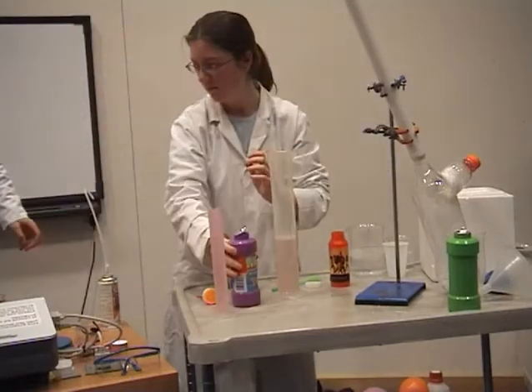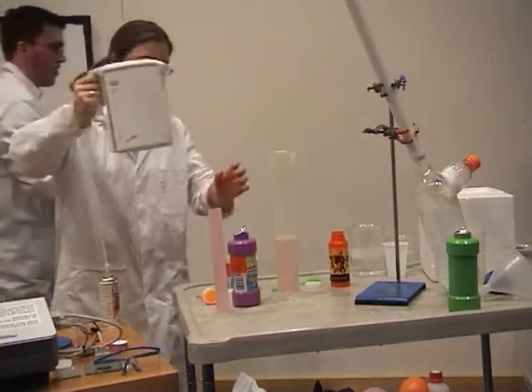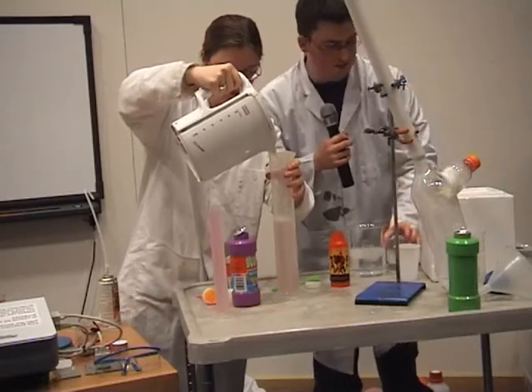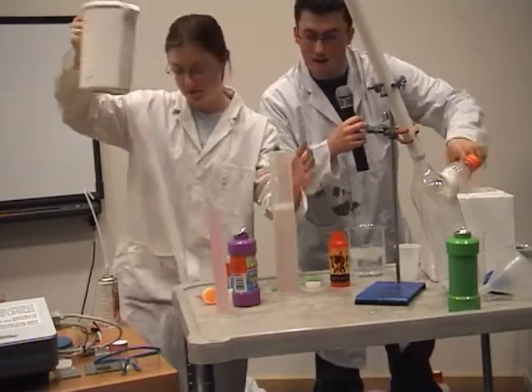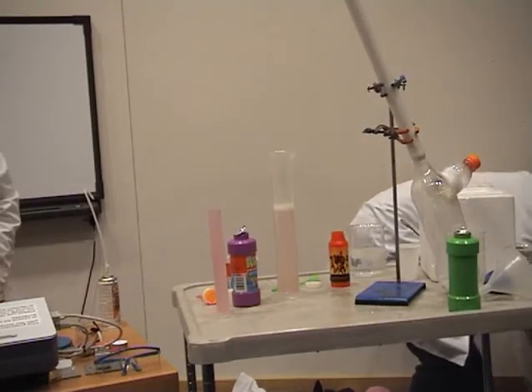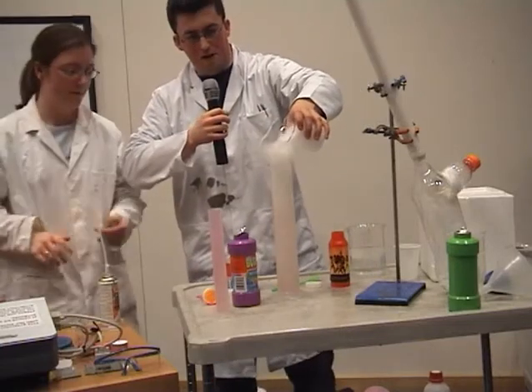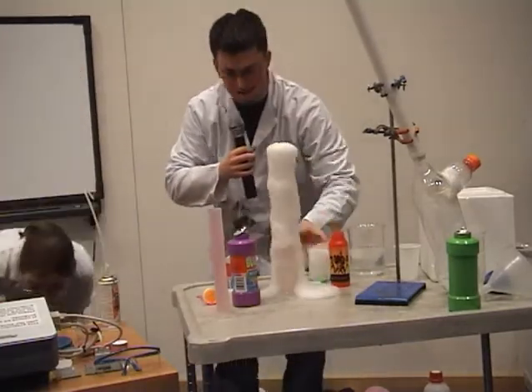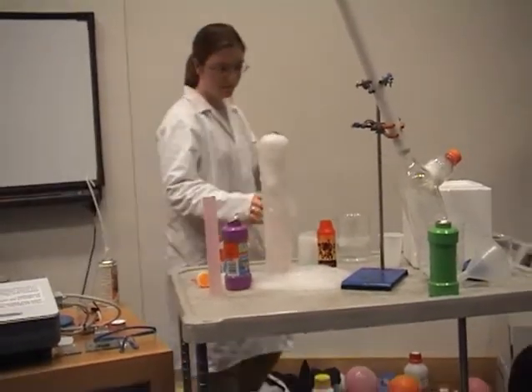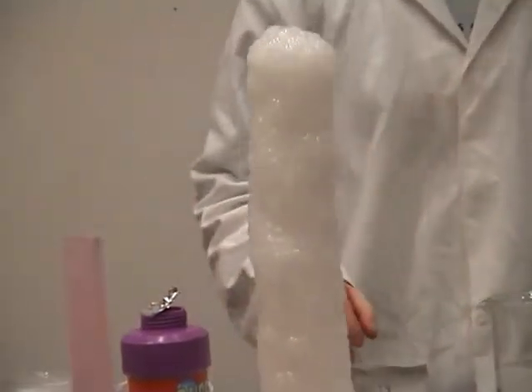Now, first of all, we're going to use our good old friend, carbon dioxide. So we're going to get some of the dry ice and throw it in, see what effect it has on the bubble solution there. Now we've added hot water in, so you can see it's just like the snake, and we've got a flame. So, what do you think will happen if I put this flame near the carbon dioxide?